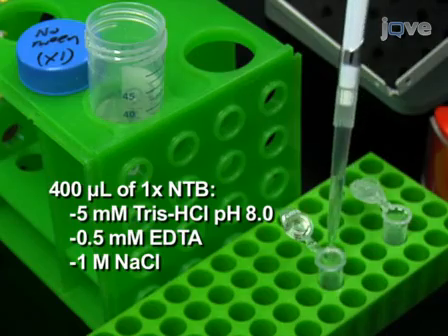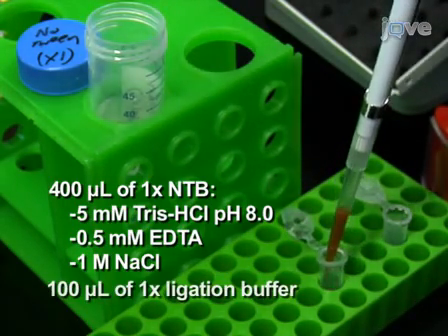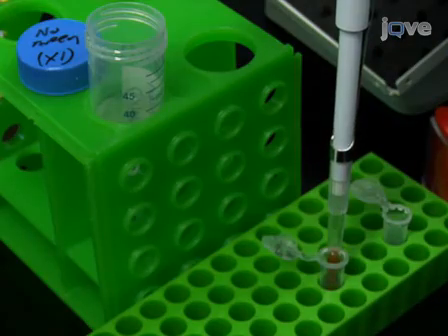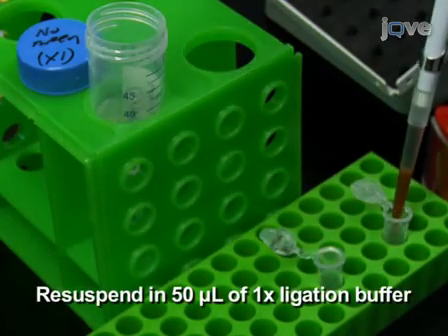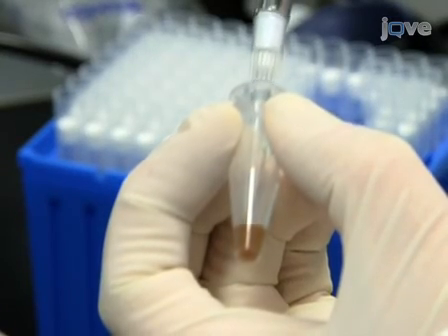Wash the beads with 400 microliters of 1x no-tween buffer, followed by 100 microliters of 1x ligation buffer. Resuspend the beads in 50 microliters of 1x ligation buffer and transfer the mixture to a new tube.